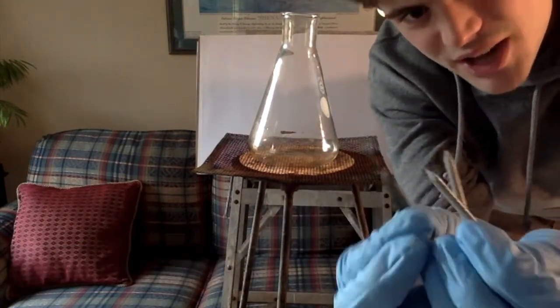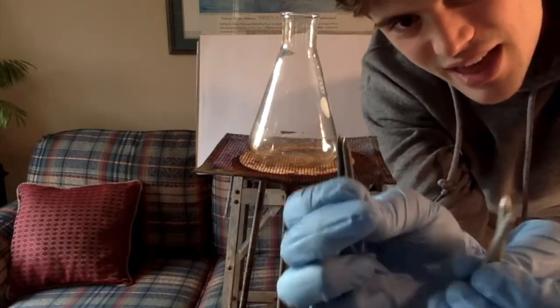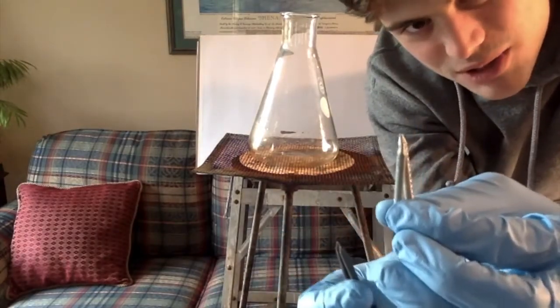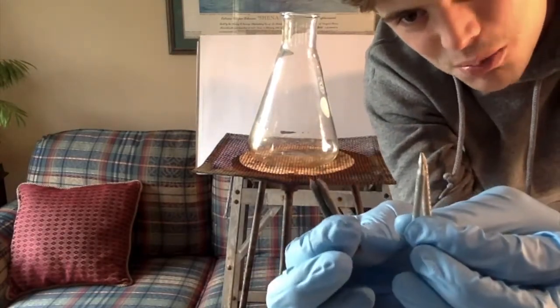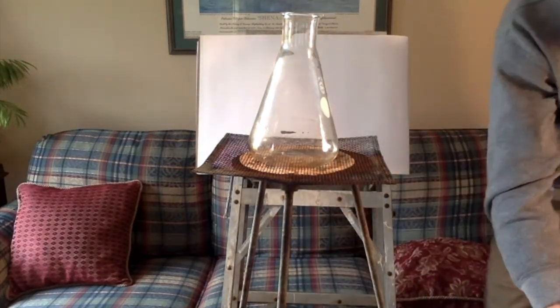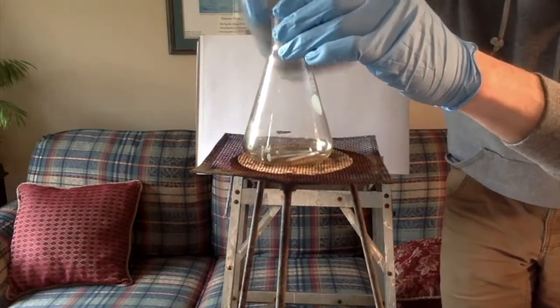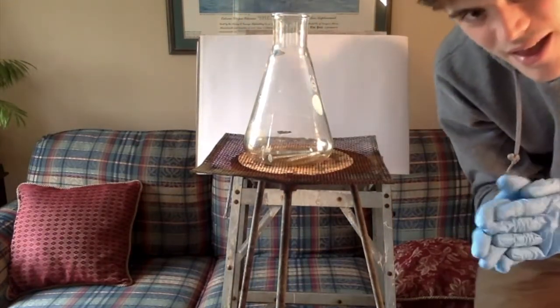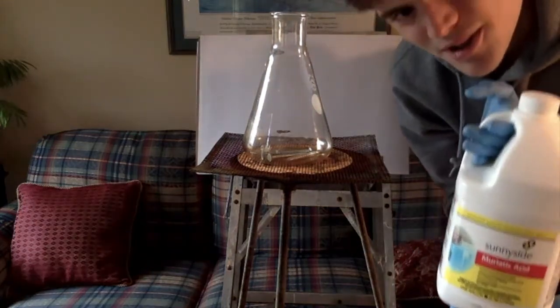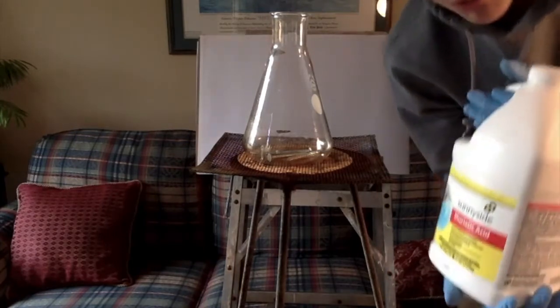Here are some nails that I have already used in this experiment a little bit earlier, and you can see that there's no zinc left on these nails. These nails are shiny because there's zinc on them. These nails are dull because it's just the steel underneath. So, quite a few nails going into my beaker here, and now we're going to add our hydrochloric acid. Yeah, I can already smell it. Wow, got in my throat a little bit.